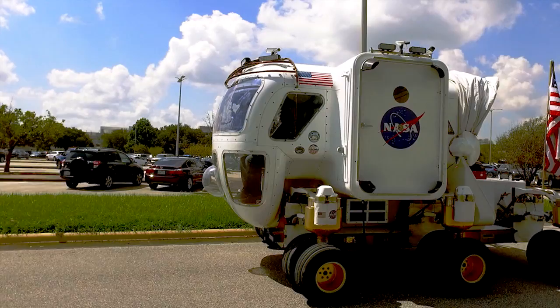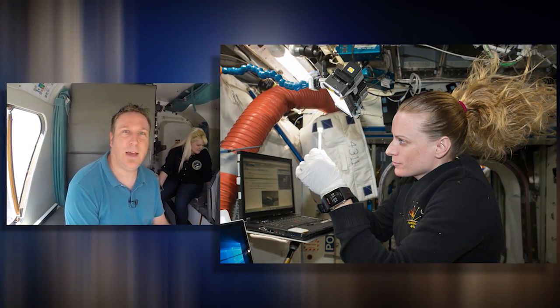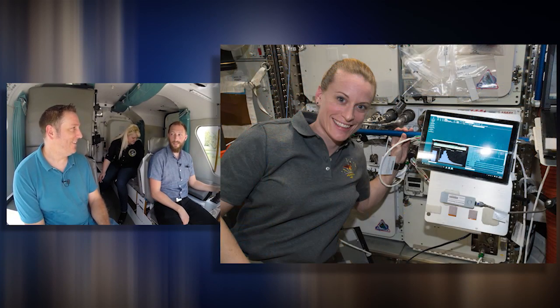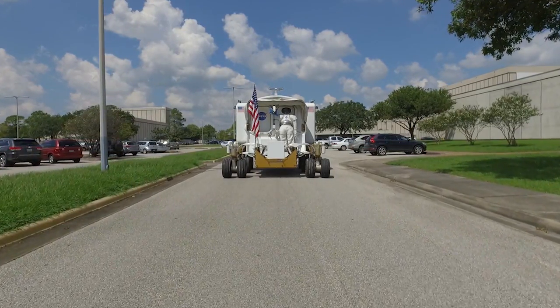How has it been working in space? From what we can tell so far, it's working even better in space. We've really exceeded our wildest expectations. We actually had a pretty big milestone the other day where we passed our billionth base of DNA sequenced in space. One billion with a B? Yes, billion with a B. The human genome is about three billion base pairs, so for us to get a billion bases in space really gets us on that same scale, which is pretty amazing.